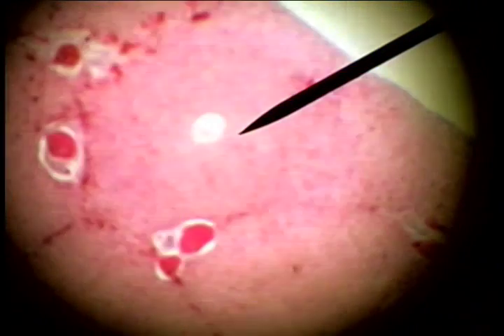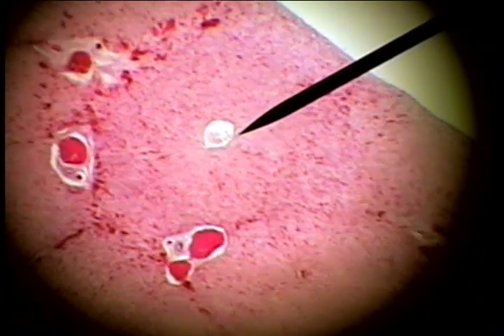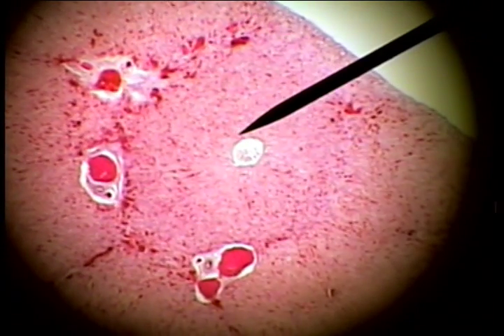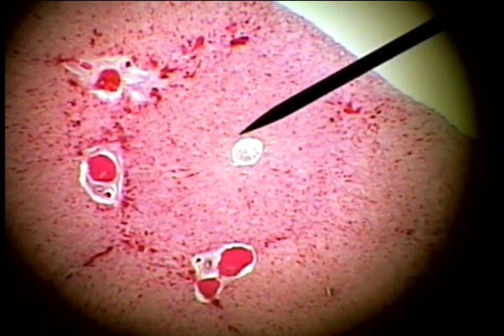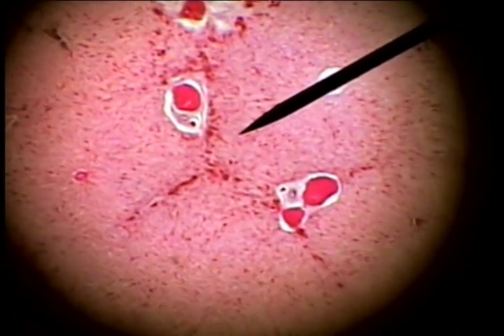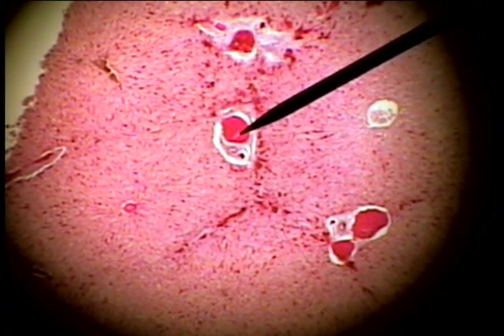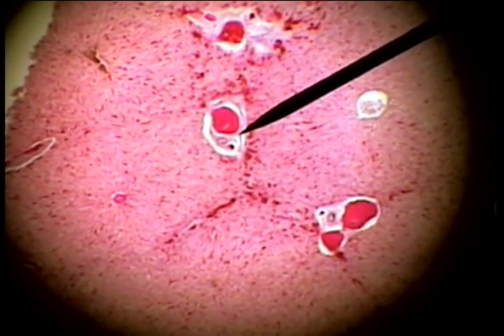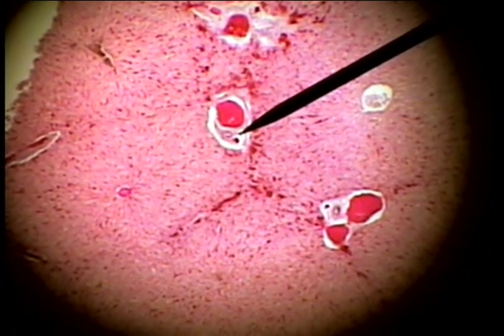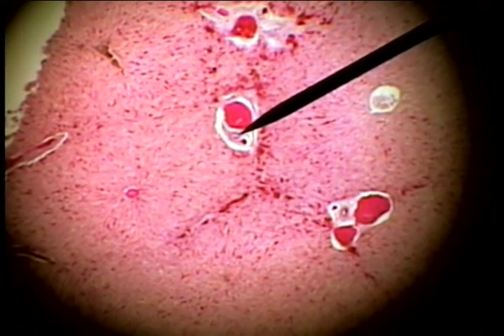At the edges of each lobule, there are the portal triad, and the portal triad is made up of three vessels: the portal vein, the hepatic artery, and the bile duct.